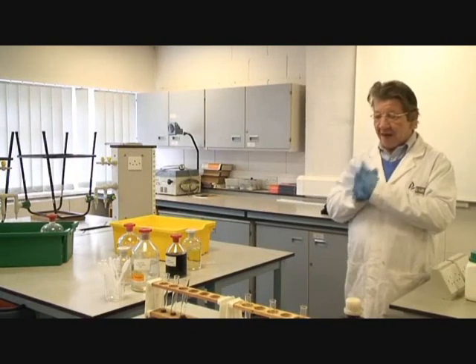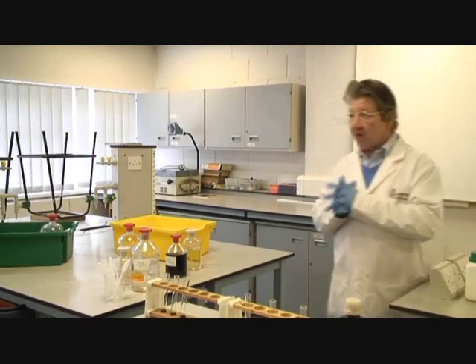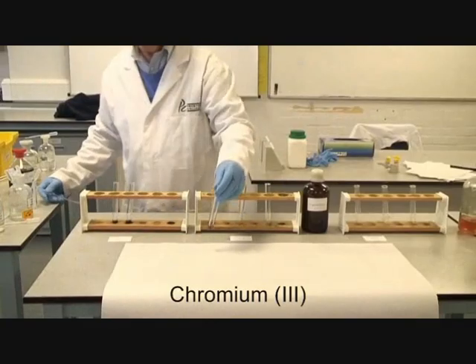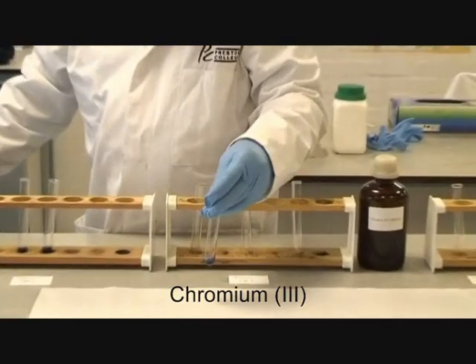We'll do this sequentially, a metal at a time, and note all the observations that we do as we go through this. This is chromium 3 in solution.